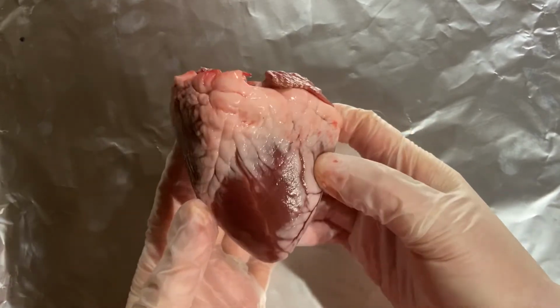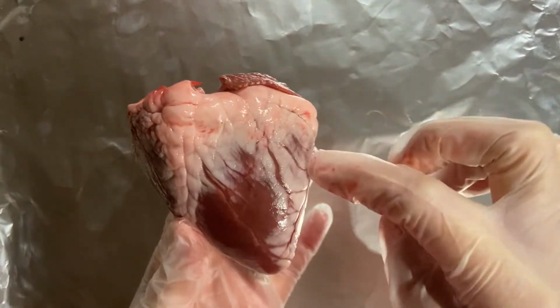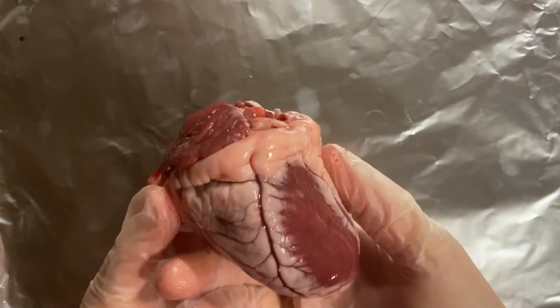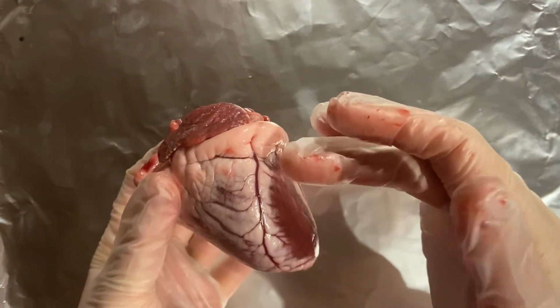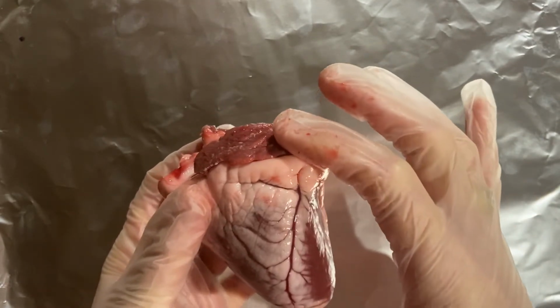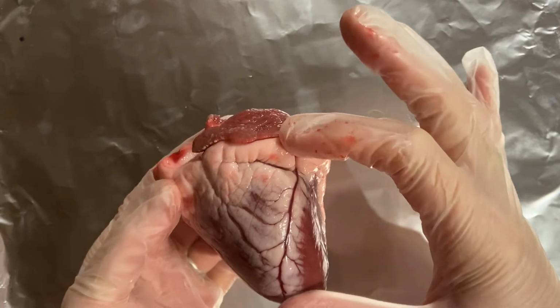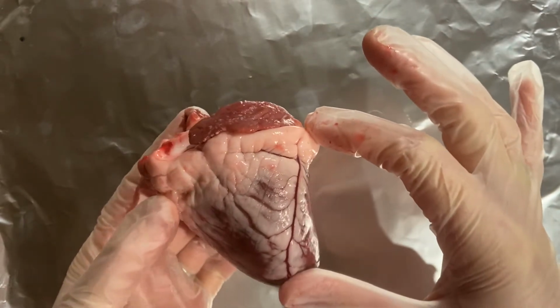Now, you might be surprised at how much fat there is around this heart, but we do need a certain amount of fat in order to make sure that the heart is insulated, especially when we're jumping around, and it just helps to absorb some of the shock as we are moving around.